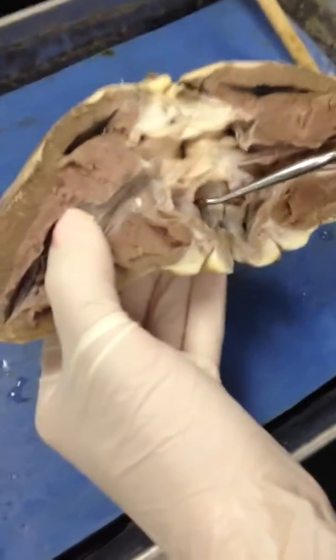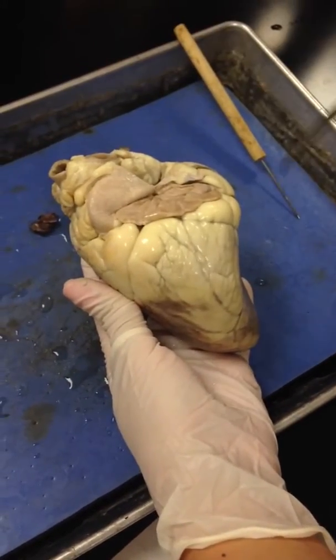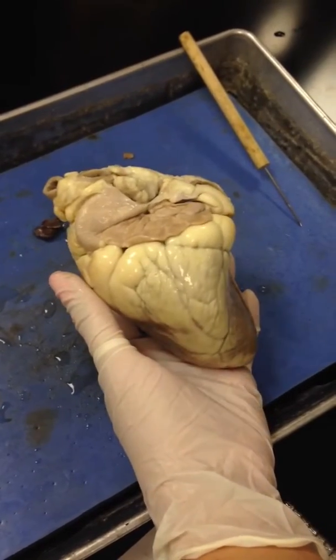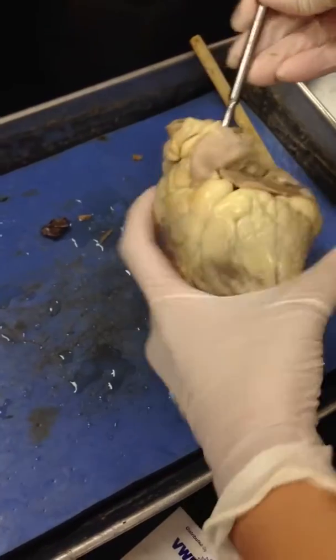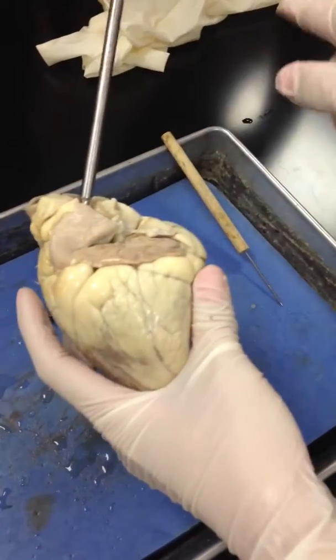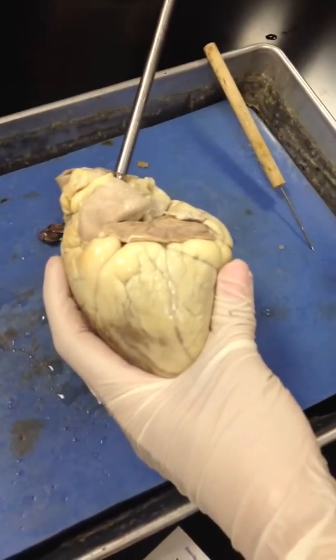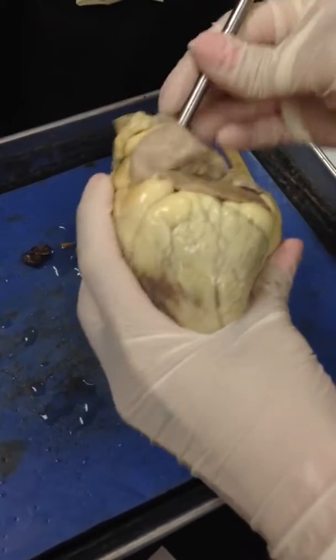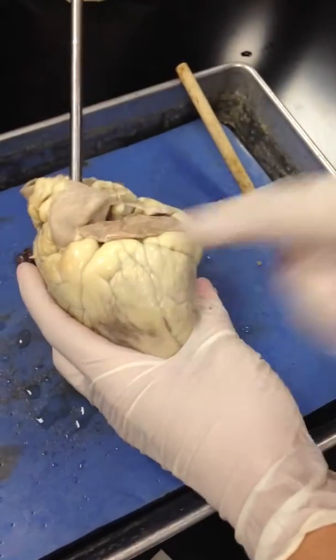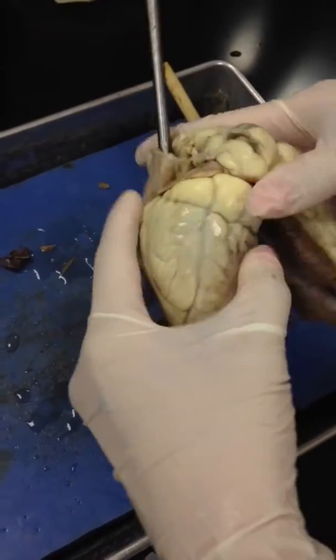Now getting into the vessels and valves. So again, we're looking at the anterior. We think that this is the pulmonary trunk, but how are we going to be sure? What you want to do is take the probe and pretend that this is the flow of blood through the heart. So the blood would be coming from the heart, shooting out into where? This is the pulmonary trunk. So it should go through the pulmonary arteries into the lungs. So if this is the pulmonary trunk, where would the blood be coming from internally? From the right ventricle. Good. And is that true?